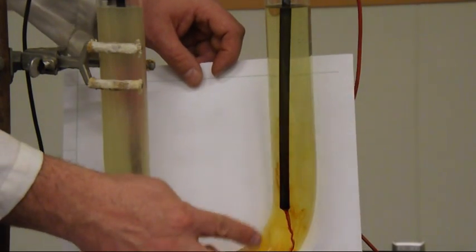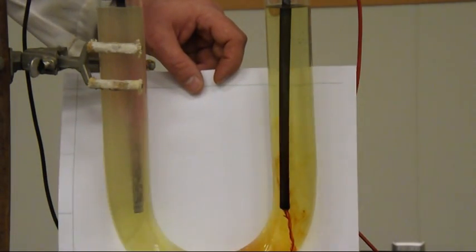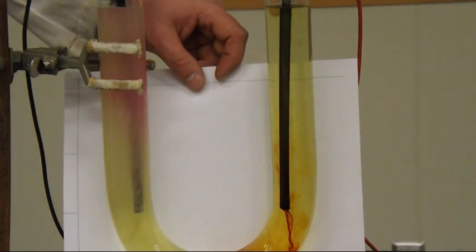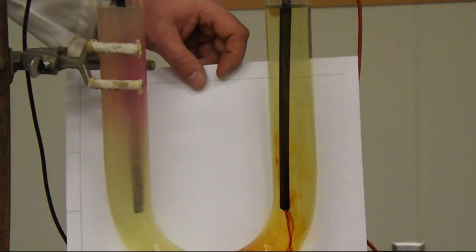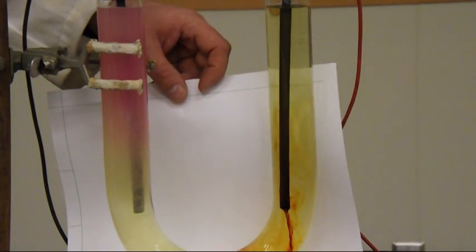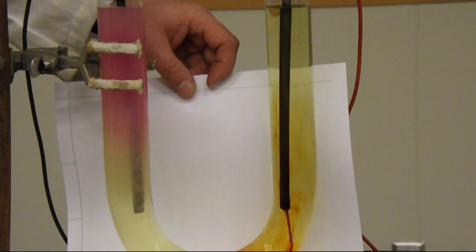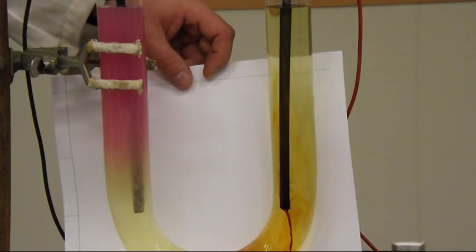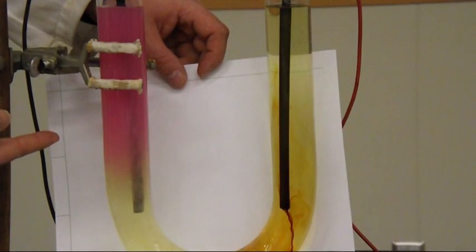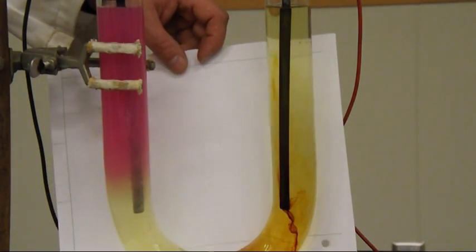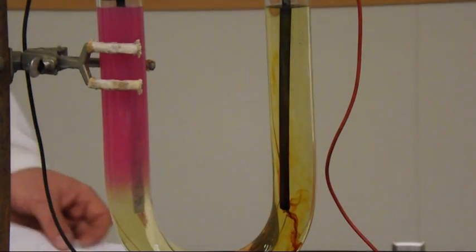On the other one you can see down here that there's this sludge that's actually drawing off the bottom of the electrode. And that sludge is brown in color. So what most likely is being formed there? I minus is what we start with. This is I2 that's being formed there. So basically and now look at the coloration over here.